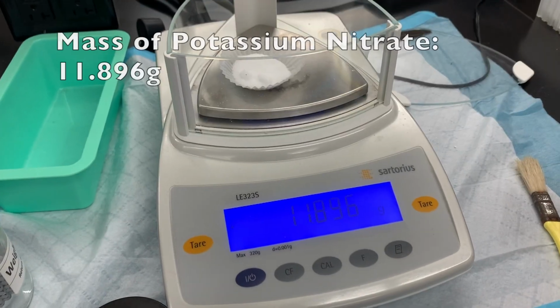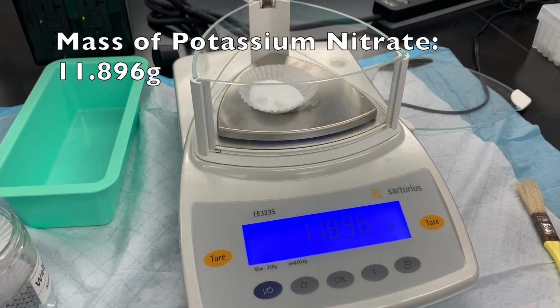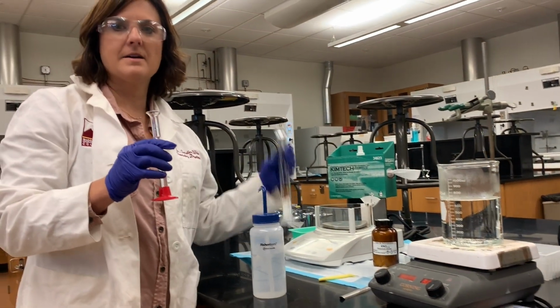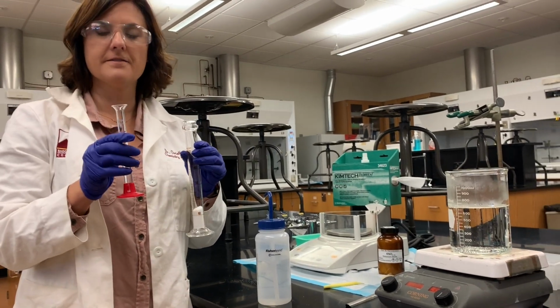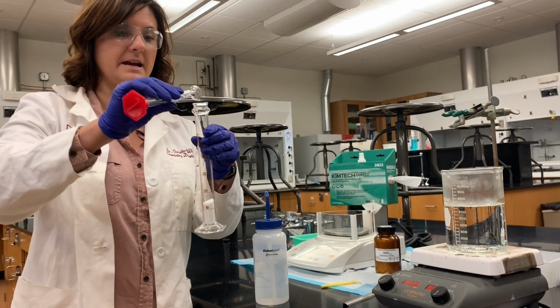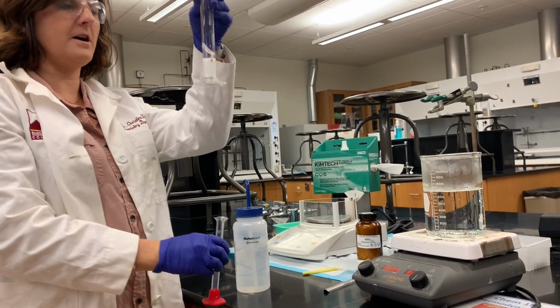All right, so we have 11.896 grams of potassium nitrate. I'm going to go ahead and put that in a graduated cylinder and add water. Okay, so I'm going to add 9 mL of deionized water to the 11.896 grams of potassium nitrate that I measured out. And obviously that's very little water for all that solid.